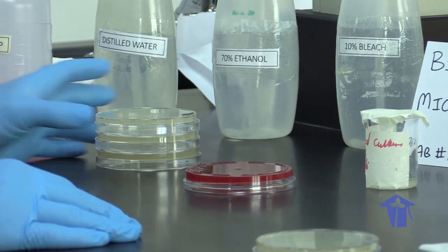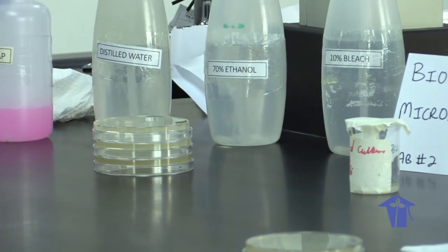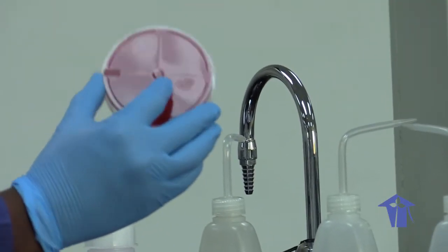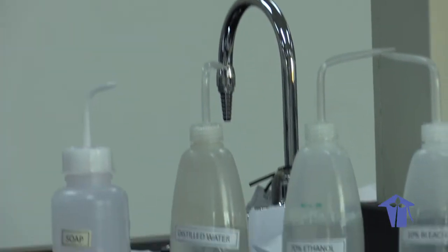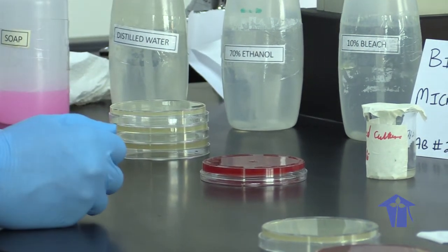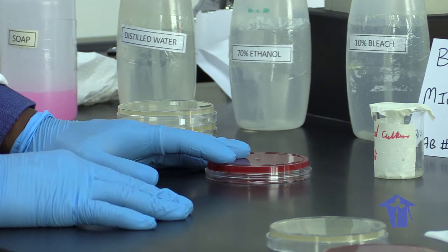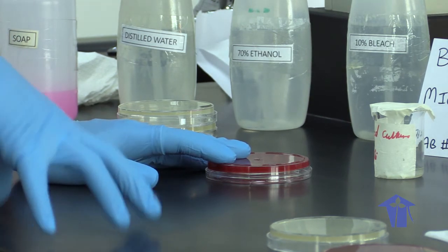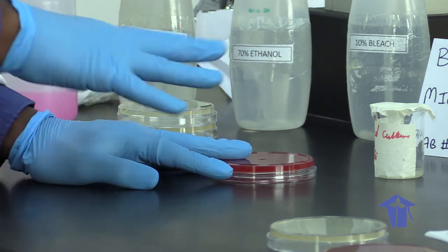Here we have two different types of agar. This is blood agar — typically we use sheep's blood, introduced to the agar while it's still molten. When it solidifies, the agar becomes a hard layer which has the nutrients of the blood within it. Blood agar can be differential in that if you have organisms which are able to break down red blood cells, you will see a color change in the agar itself.